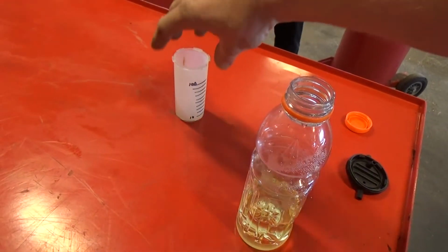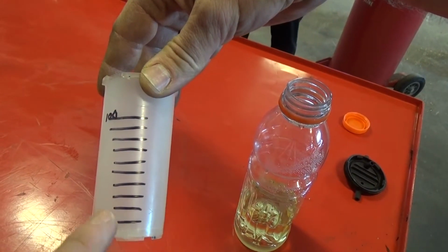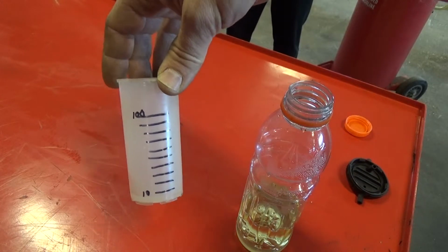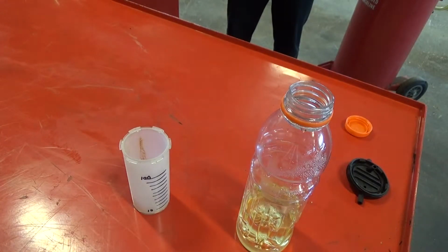All right, so what we did is we took a bottle, and this has divisions on it. It's 0 at the very bottom, 10 is marked here, and then up to 100. And what we're going to do is take a percentage here. We're going to put a fuel sample in and put a water sample in. We're going to shake this, and then it's going to absorb into the alcohol. The alcohol is going to fall out, so you're going to get a division line.